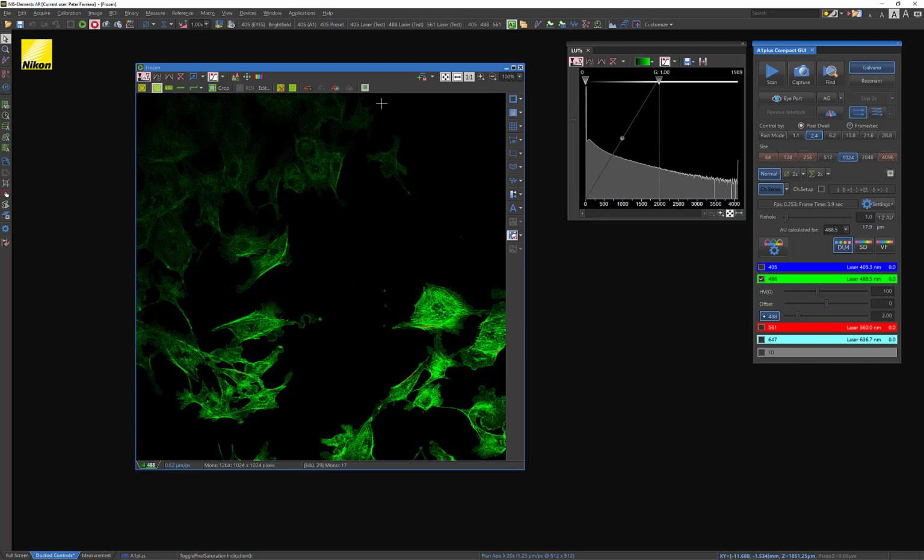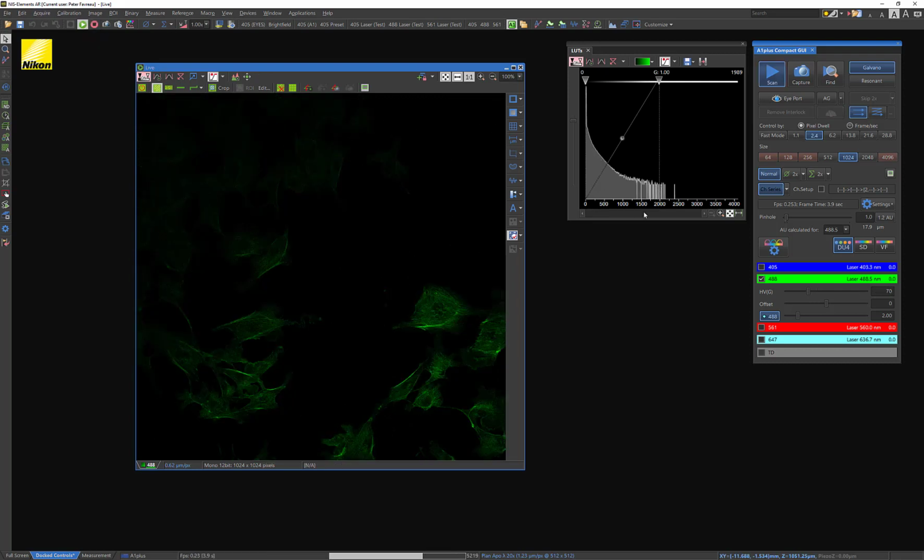This is one of these things where you may think, I've got a very bright image, but it is saturated in some of your pixels, which can make image analysis later very difficult and potentially not possible because there are pixels that have saturated and won't be able to give you any good data. So I'm going to lower this, of course, back down to 70, which is a value we liked. And we're back down to 2000.